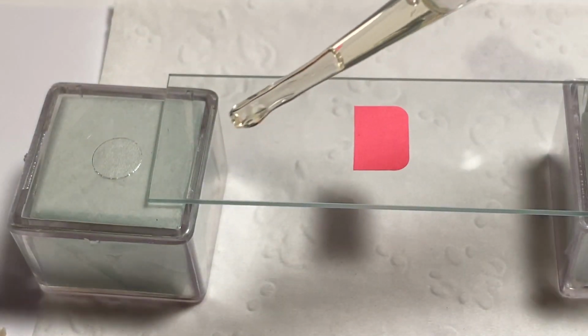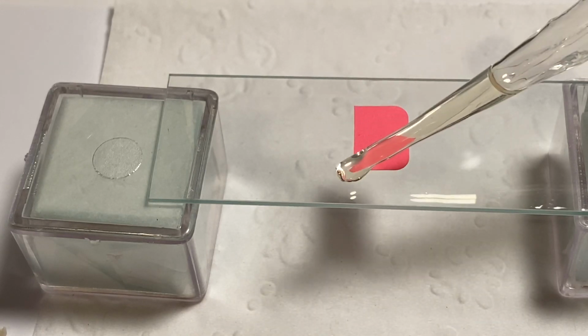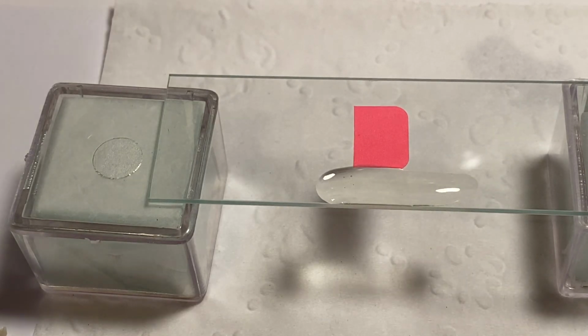Let me just use the higher magnification. You see there's an air bubble in the front. I'm going to squeeze it so there's no air bubbles. I'm going to just do it like a bead across the bottom like that.